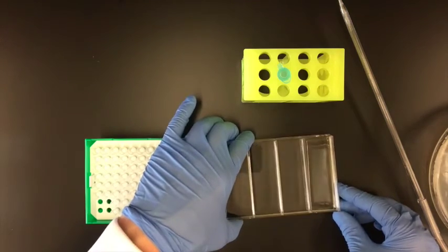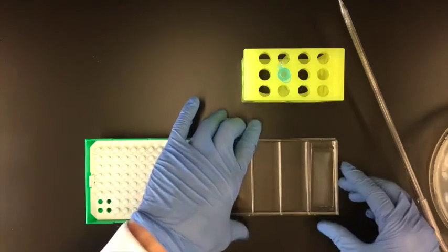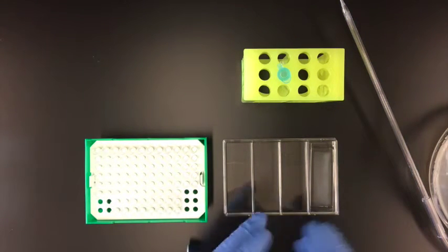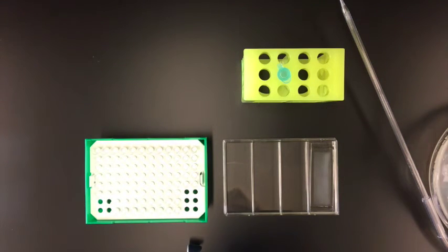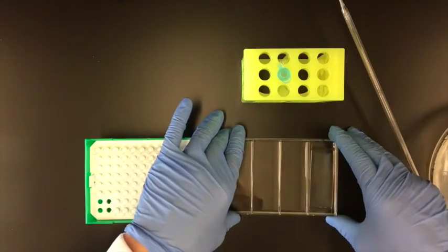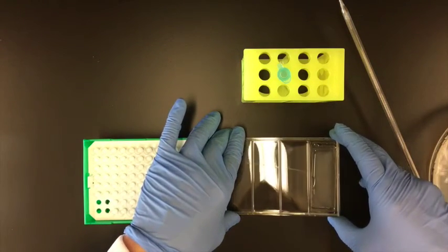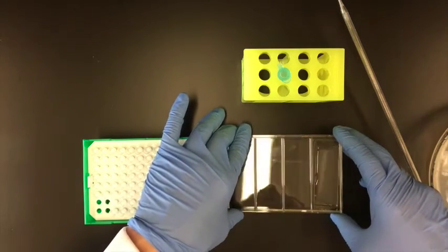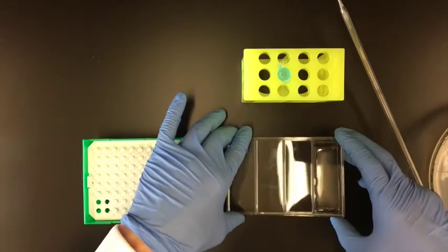So that I get all of the edge wells loaded with beads. Now I can let this sit here and give those time to load. So now another thing that I can do, I typically then try to move the unoccupied beads to the other side and do the same thing on the other side of the device.